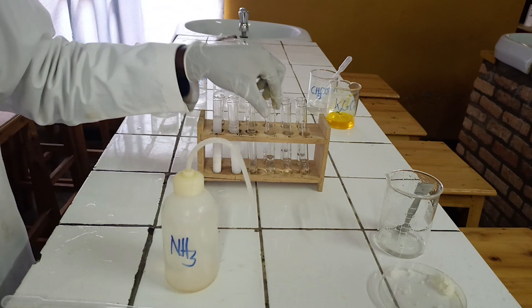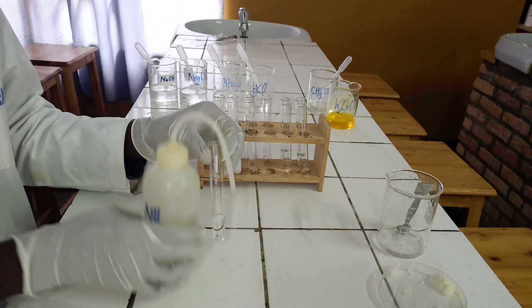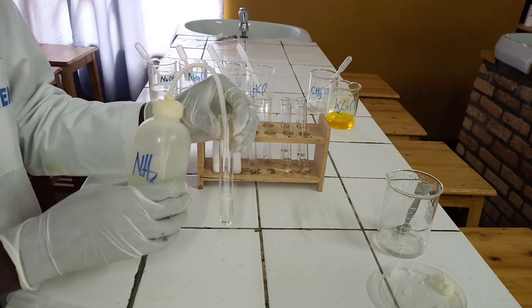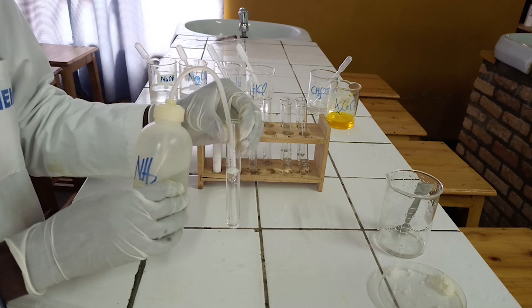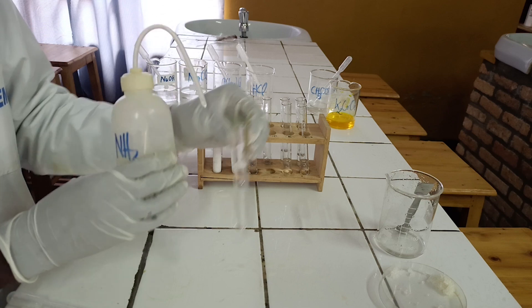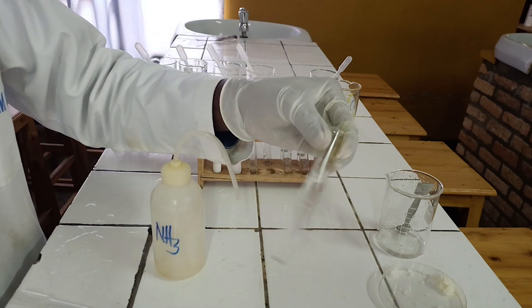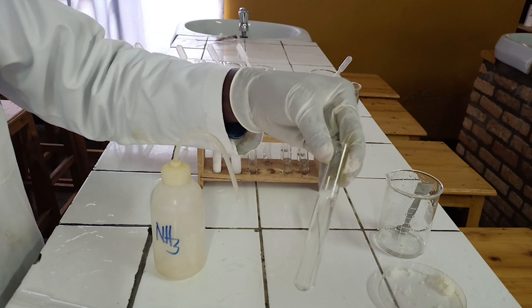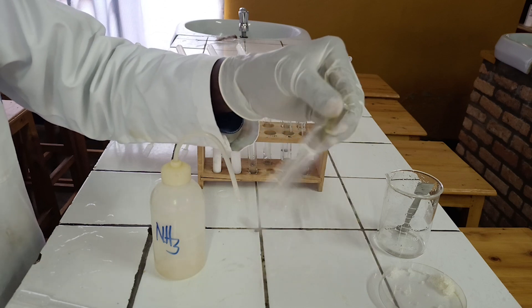To the fourth test tube, add ammonia solution dropwise until in excess. As you see, ammonia does not react with calcium ion — no observable change.